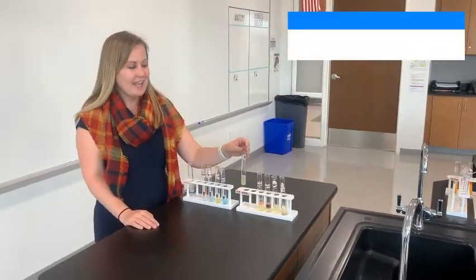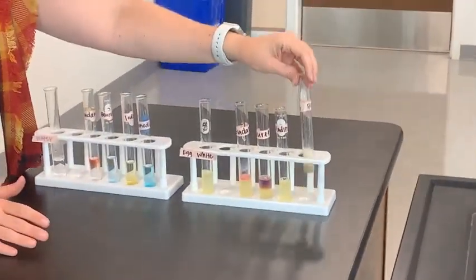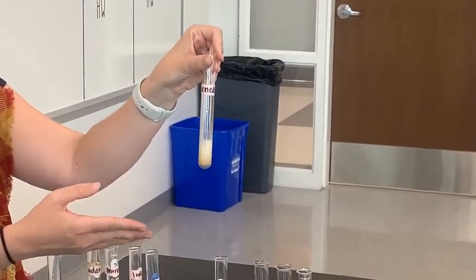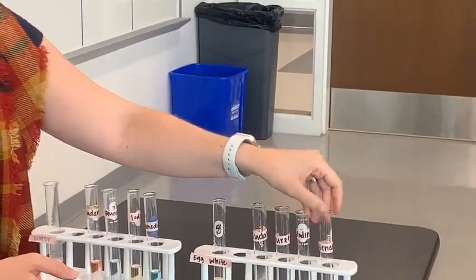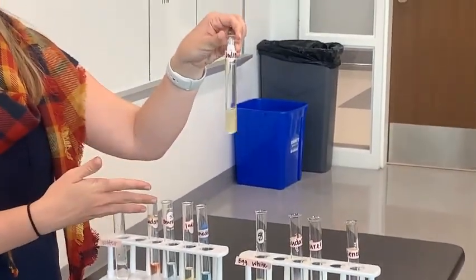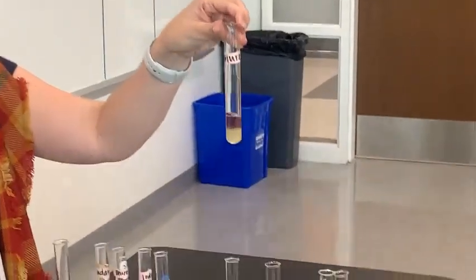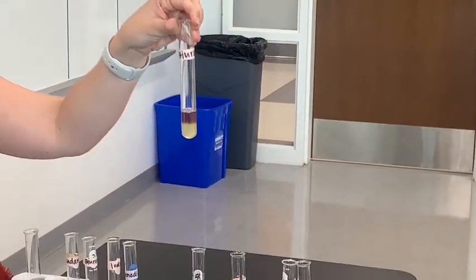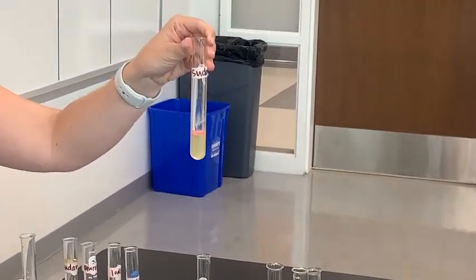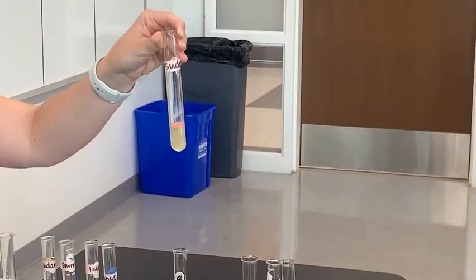The first test we did was with egg whites. Before testing, the egg white is a pretty pale yellow. With the Benedict's test, we definitely see a change from blue to kind of an orange-yellow color. With the iodine test, it's still that yellow-brown color — we don't see a change to dark black. With the Biuret test, we went from that light blue to a really dark, vibrant purple. And with the Sudan test, comparing it to water, it looks a little bit darker red, so there was a color change.